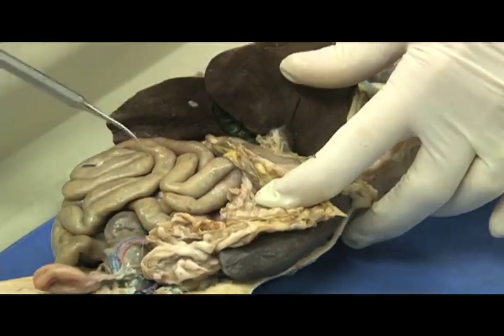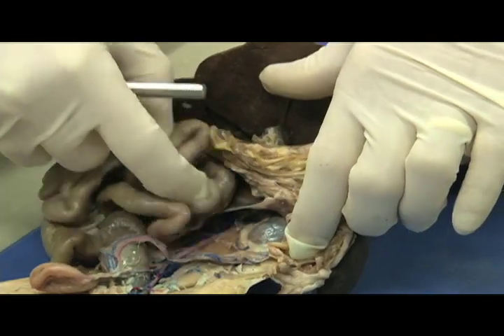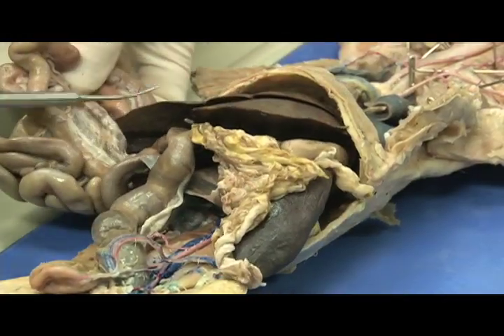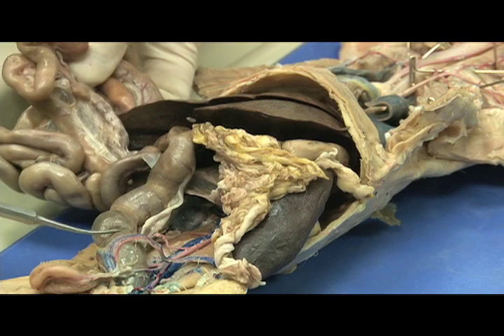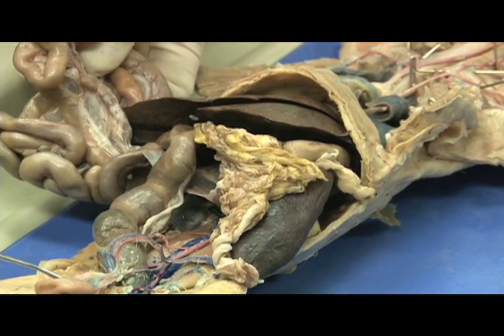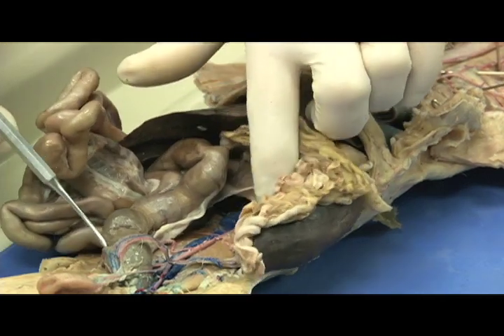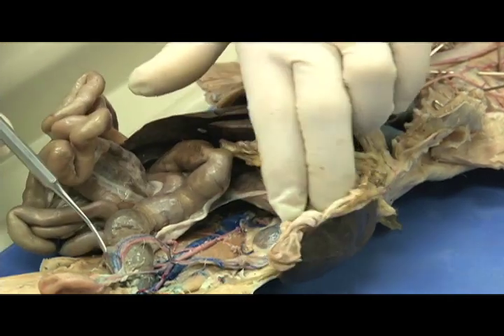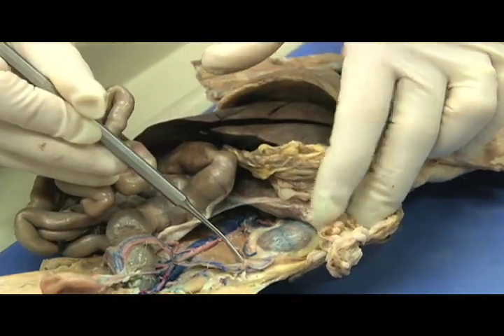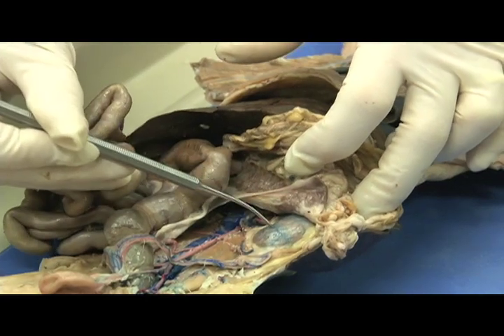This is the small intestine. Large intestine. The urinary bladder. This is a female specimen, so this is the uterus, uterine horn, the ovary, and the kidney.